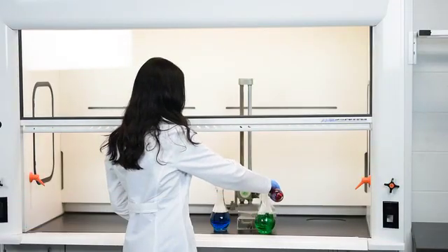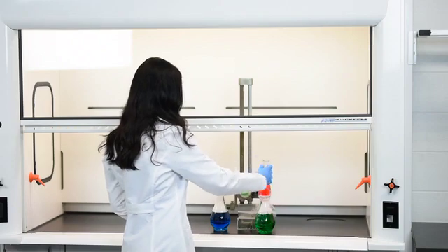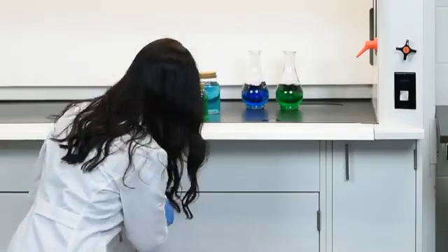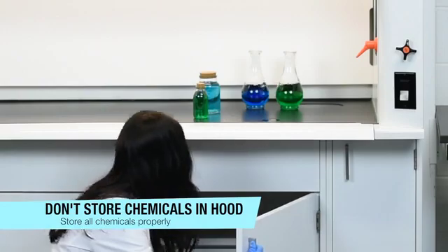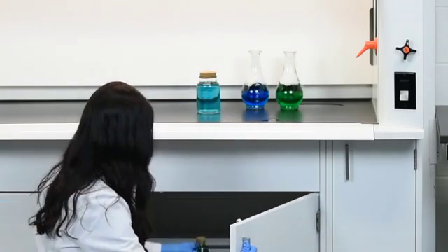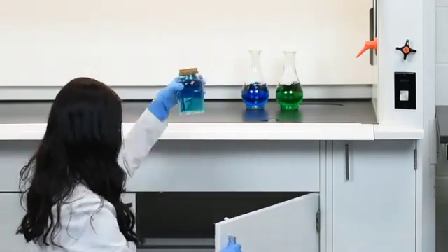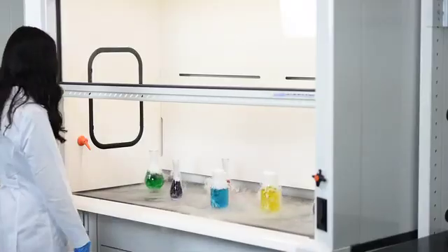Always make sure all equipment inside of your fume hood is elevated at least 2 inches. This allows for proper air flow into the baffles. Also make sure to store all extra chemicals in the proper storage. Do not leave them in the fume hood while you are working with other experiments.